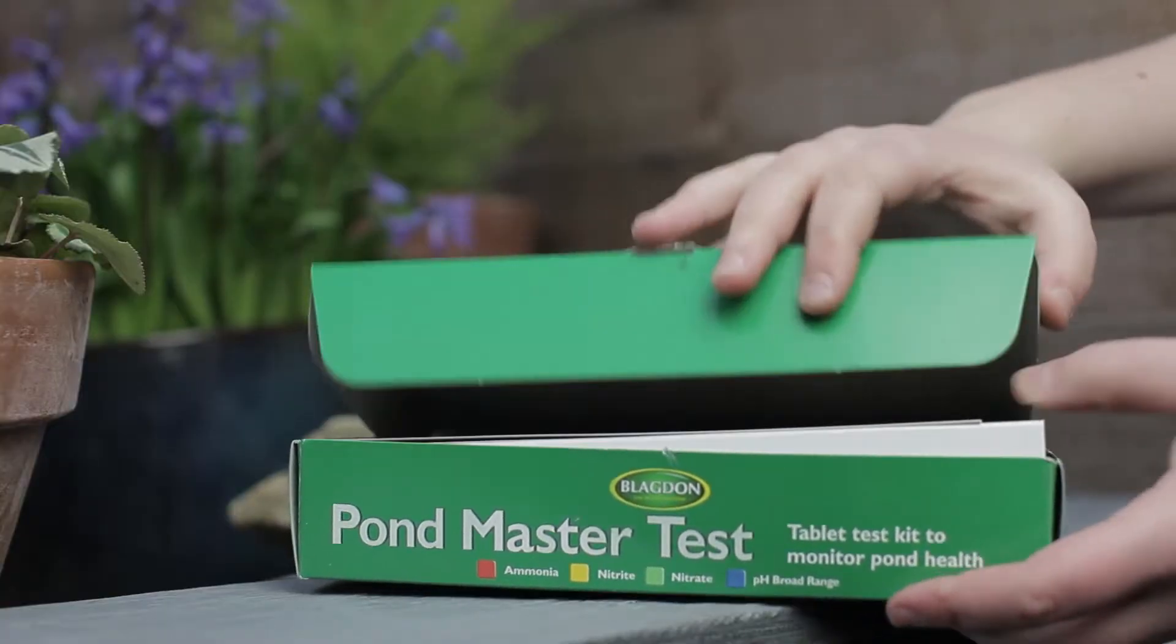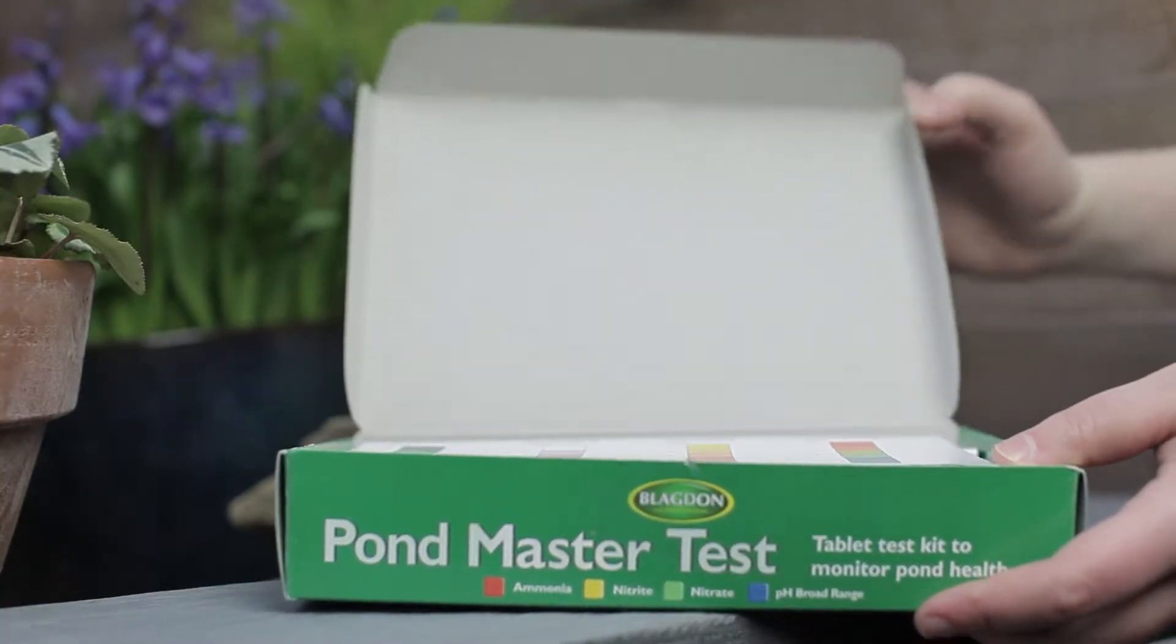Testing the water in your pond should be a regular part of your maintenance routine. Regular tests can help you to find underlying water quality issues caused by excess waste, bad biological filtration or environmental pollution.